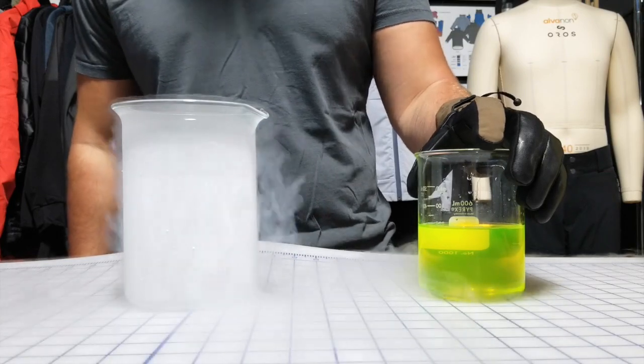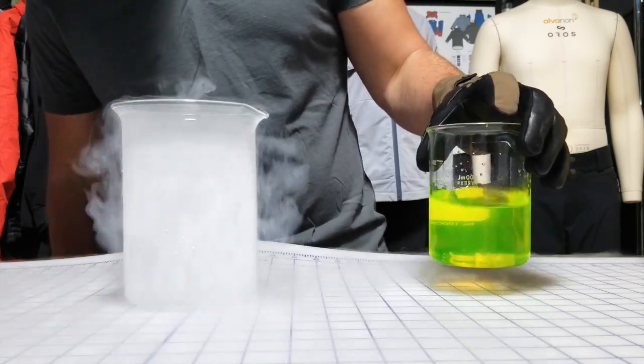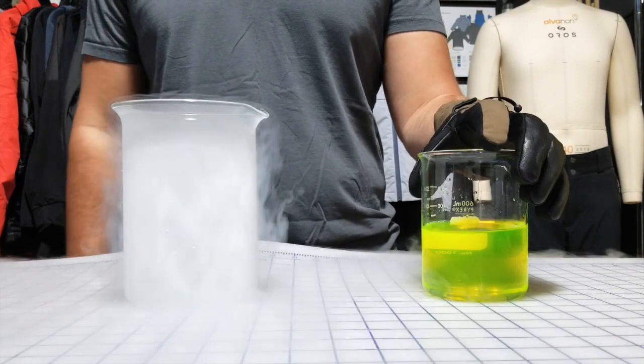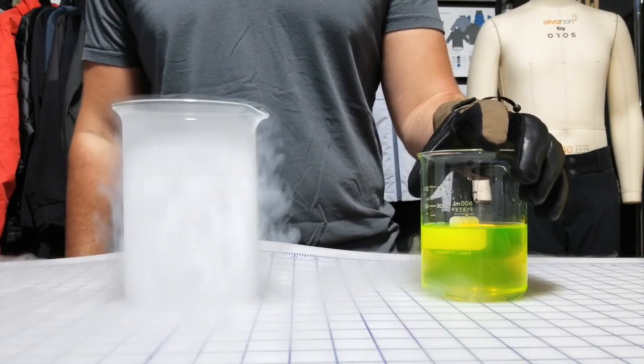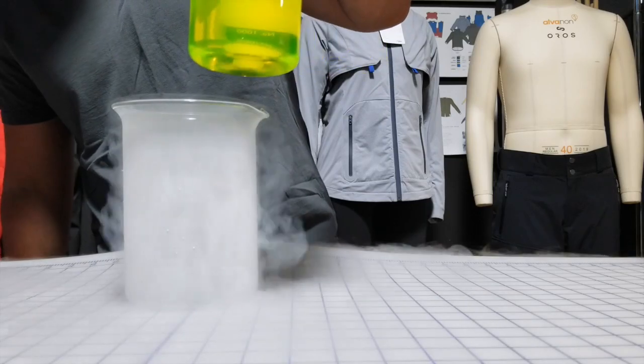Will it turn slightly more solid? Will it stay pretty viscous like this? Or will it go full-fledged like crystalline solid? What do you guys think? Let's find out.